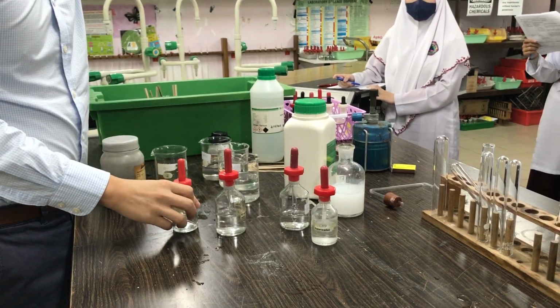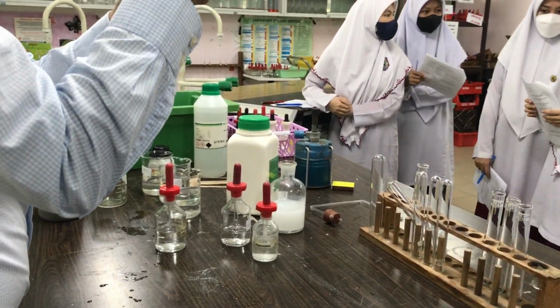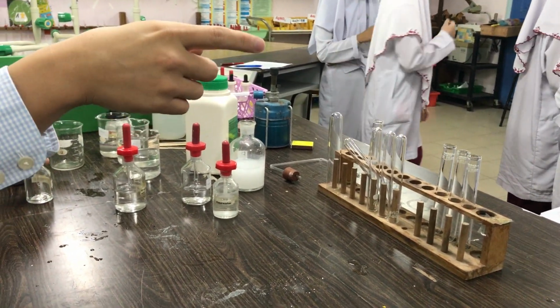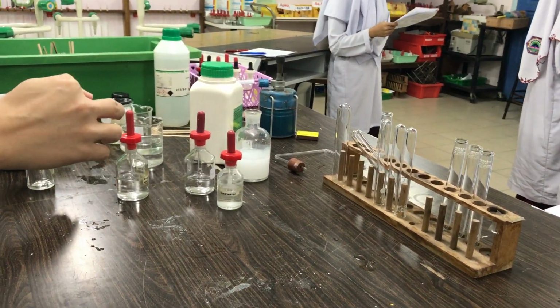I think I need nitric acid. Can you bring me some more nitric acid? I ran out of nitric acid. You see the instruction there? Add nitric acid, am I correct? Yes. So, nitric acid, find nitric acid.